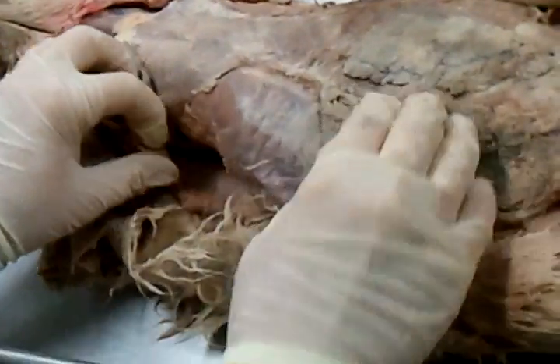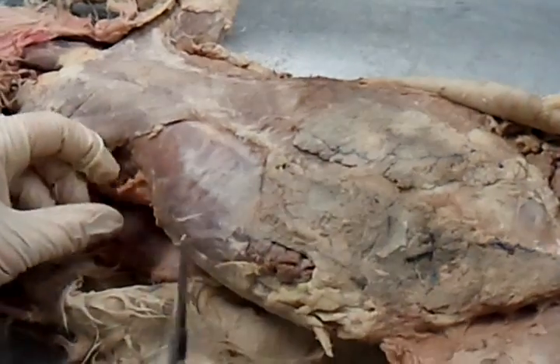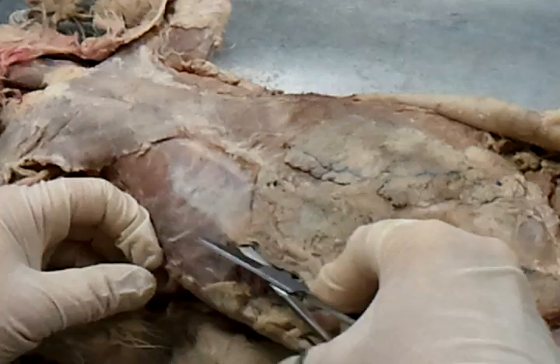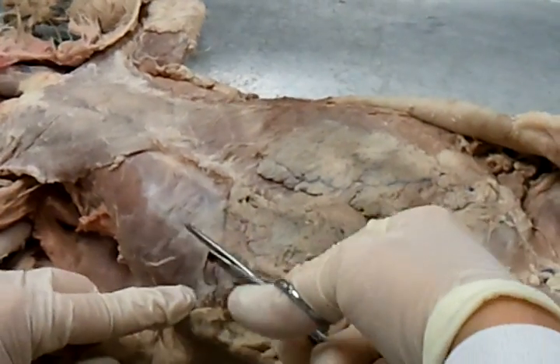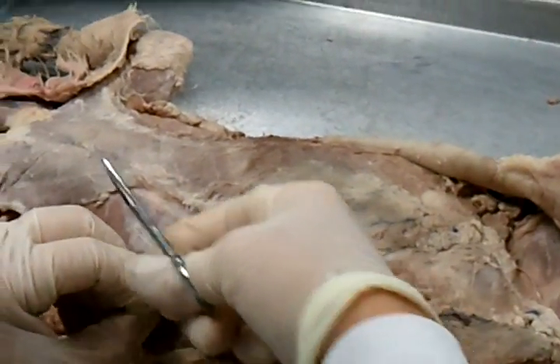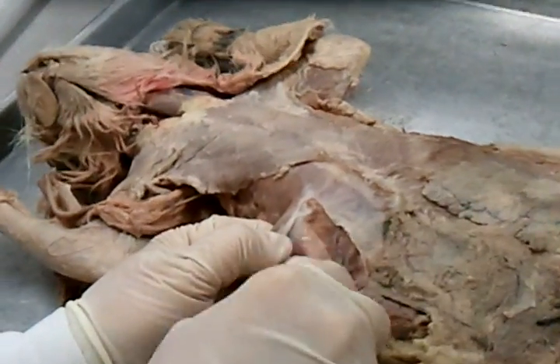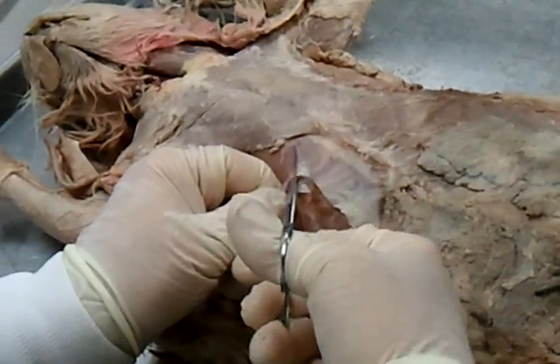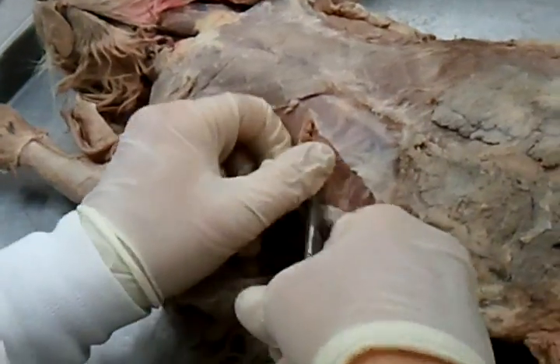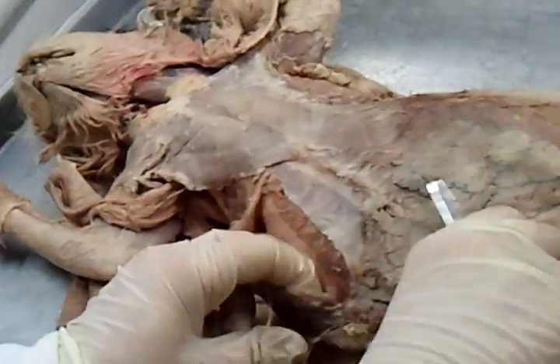What is an intercostal? What does that sound like? Ribs — okay, so you have to see ribs. There's no ribs visible here; there's a serratus under a whole bunch of fat. So what you have to do — I'm going to get under the mammary gland tissue. What's this big muscle on the edge called? External oblique. And what's this one under it that I'm dissecting towards? Rectus abdominus — see that rectus going straight up and down? So you've got to get under this external oblique where the ribs are to see the ribs. This cat's kind of fat, so you don't see them anyway.